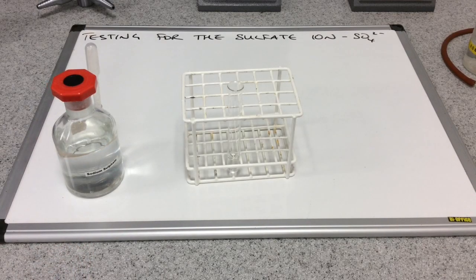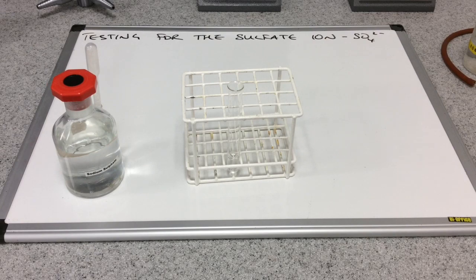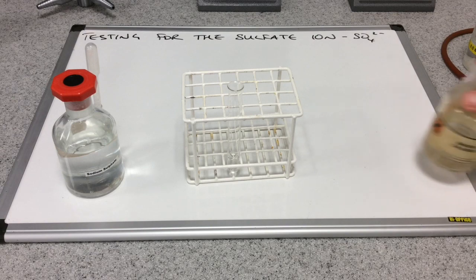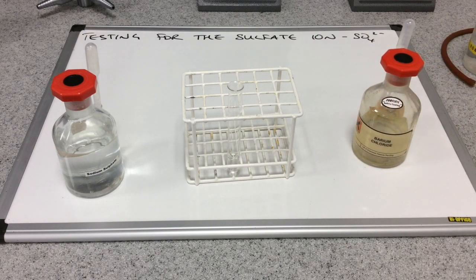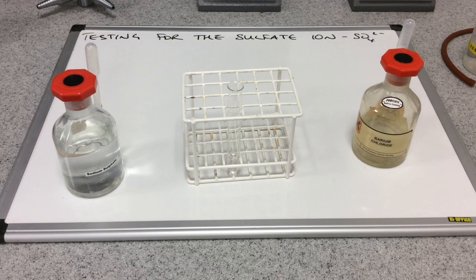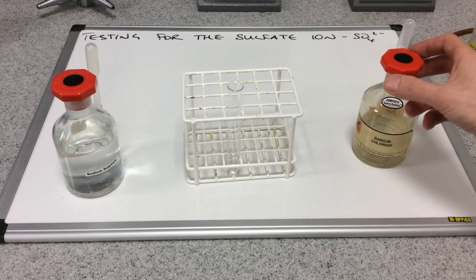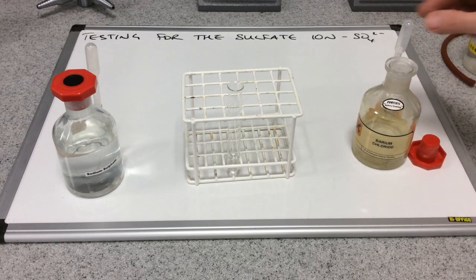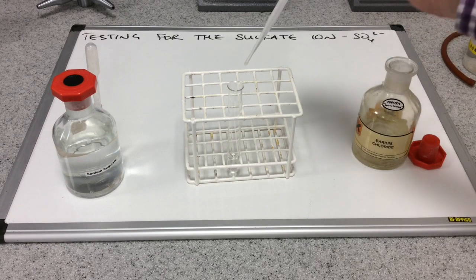I've put some of the sodium sulfate solution into the test tube in the test tube rack, and I'm going to add a source of barium ions. For this test I'm going to use barium chloride solution, so we'll just put a few drops of barium chloride solution into the sulfate ions and we'll see what happens.